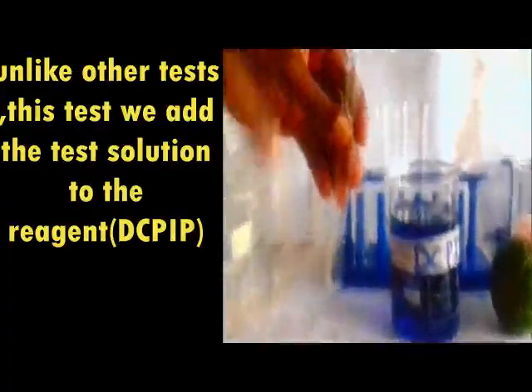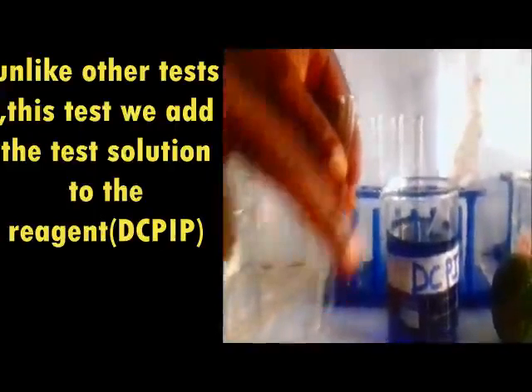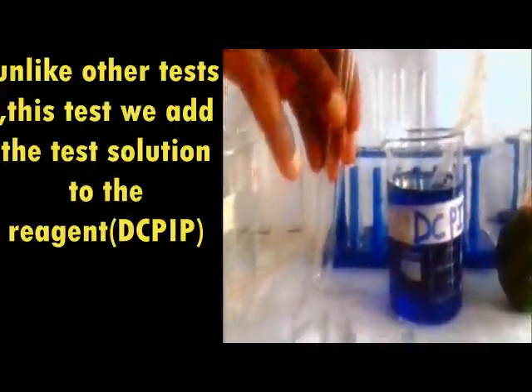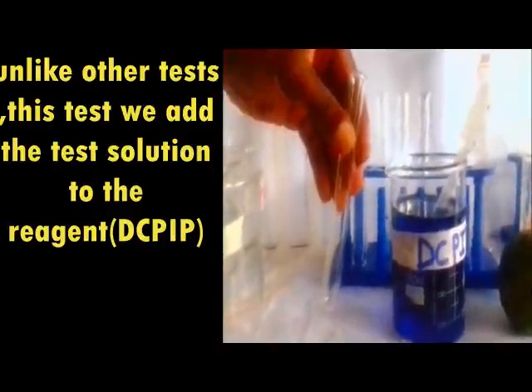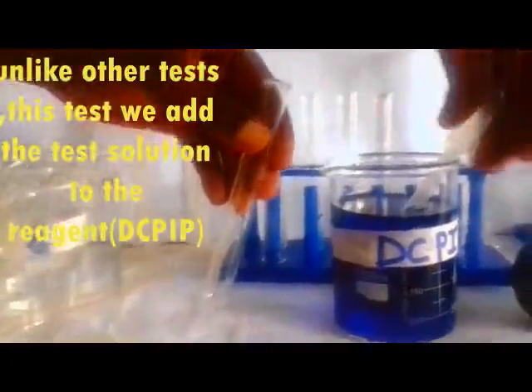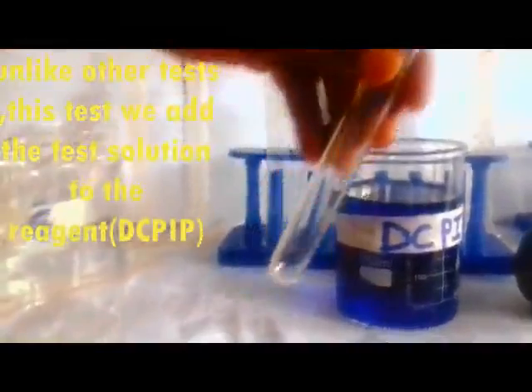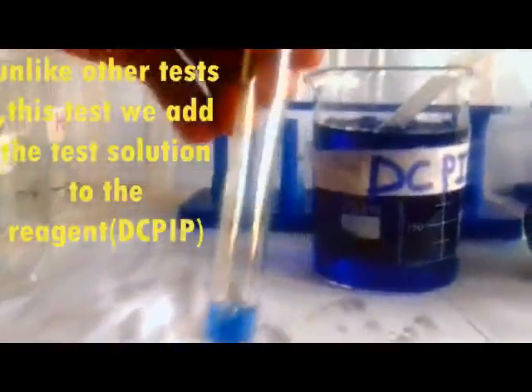Now, when you look at this test, it is the only test where you are going to add the test solution, that is the food you are going to test, to the reagent. The other ones you have been adding the reagent to the food. Now here we are adding the food to the reagent. So I get my DCPIP. Remember we said it is deep blue, as you are seeing.